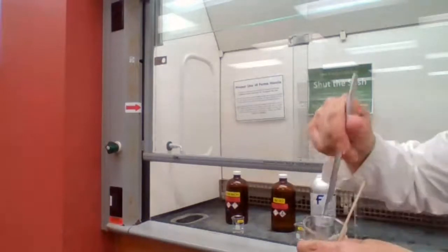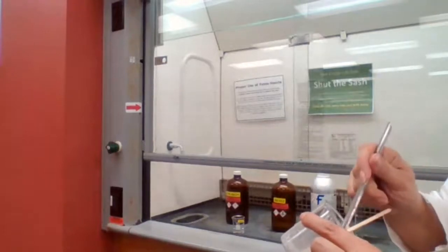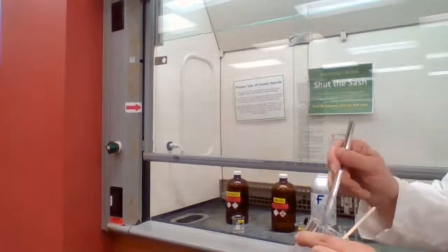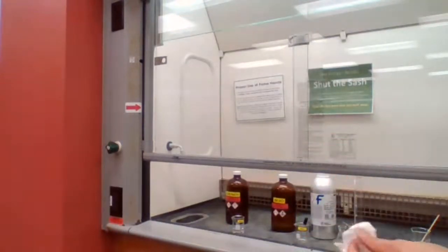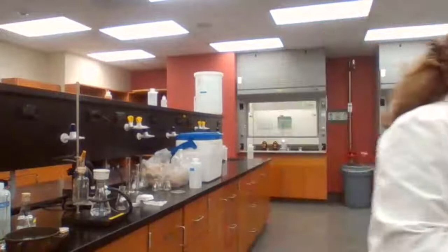I can get some of it out, place it on a watch glass, and make it dry, because that's just a quick sample. We take a small amount of it and place it on another watch glass to make sure that it dries faster, for melting point purposes only. I did the same for the benzoic acid. I placed some of the sample on a separate watch glass.